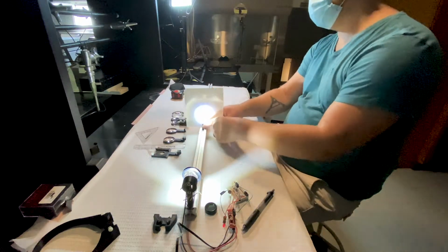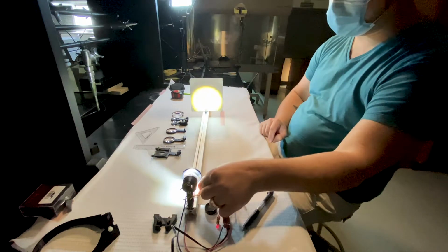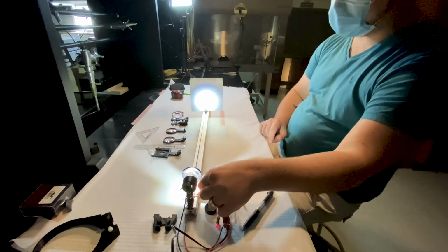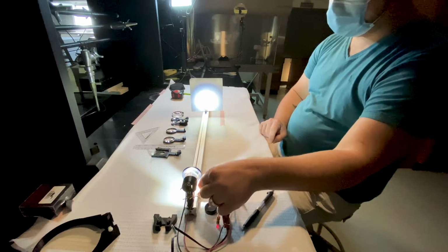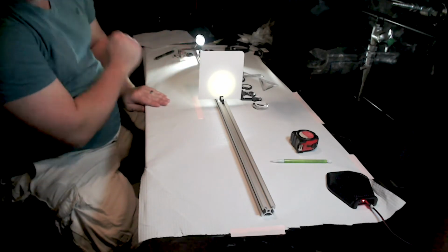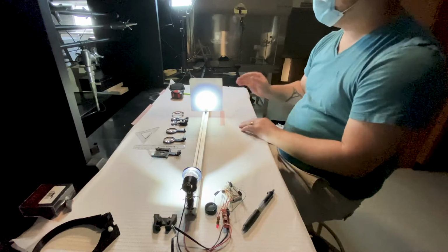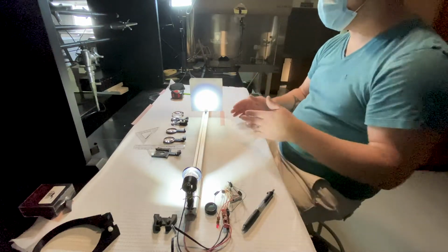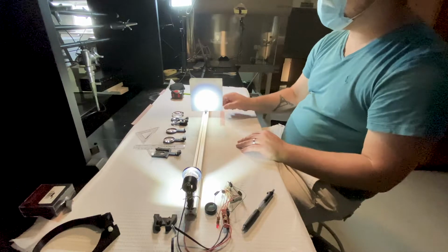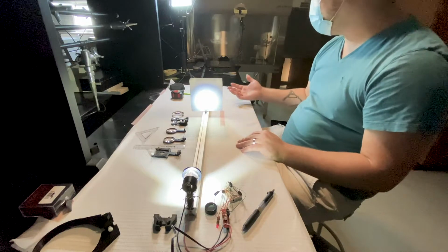And then we put, let's say, some intermediate focal plane away from this lens. As I move this lens further away and closer, you can see that there is an optimal location for this lens so that the image of this LED is formed on this piece of paper. Now, if I don't want that image on my paper, because I want my sample, which will in this case be a ruler that I'll be mounting, then it's useful to form this image at an infinite distance away, or as close as we can get to that.